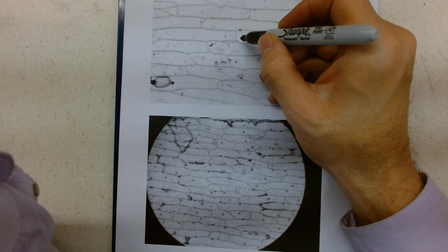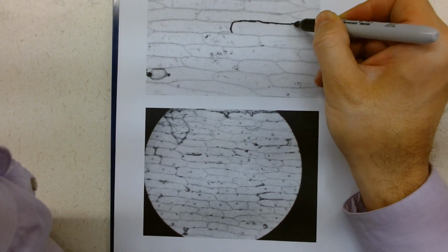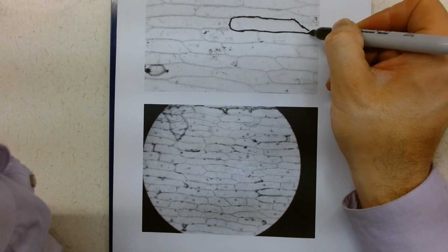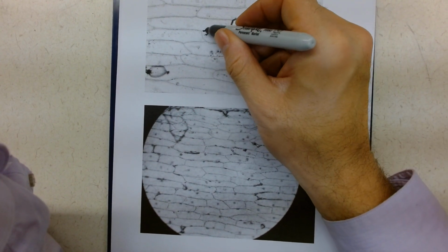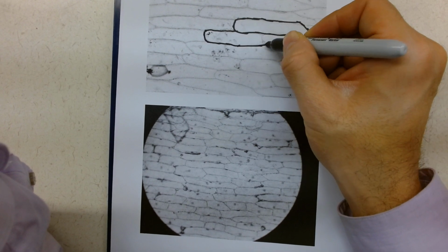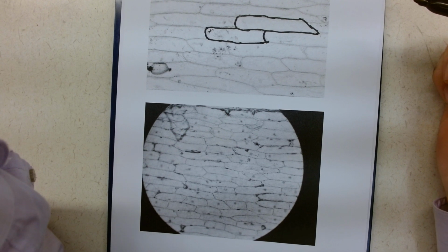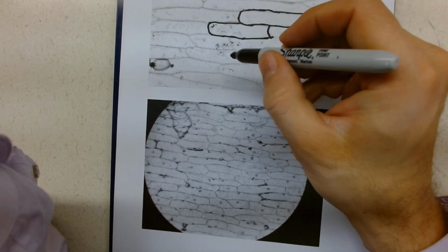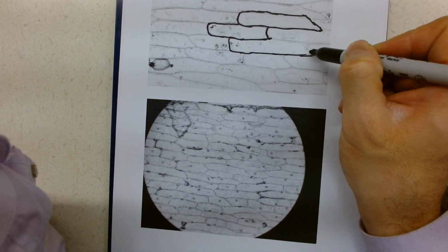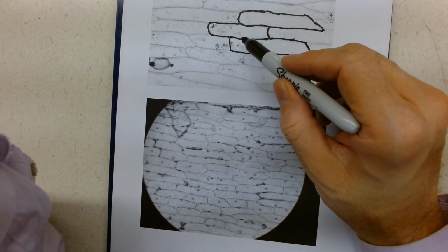What we're able to really see clearly is a really clearly defined cell. Now, as you can see, they're approximately rectangular shape. They all vary, but they have a very consistent kind of shape. So just like every human is diverse, we all have similar structures and features, but we have variation. We see the same thing here. Now, it's difficult, but you can see hints of organelles inside.